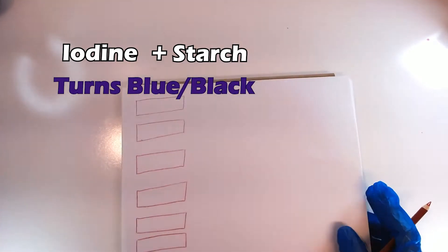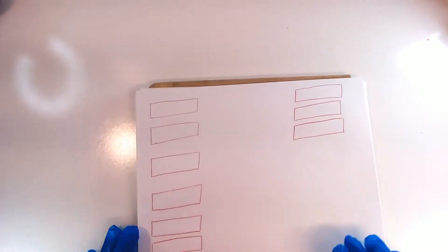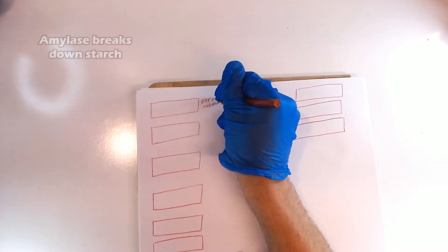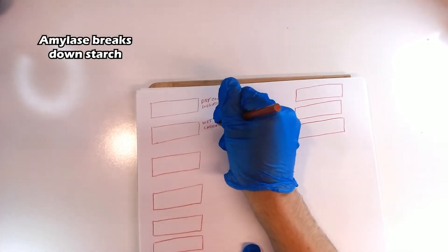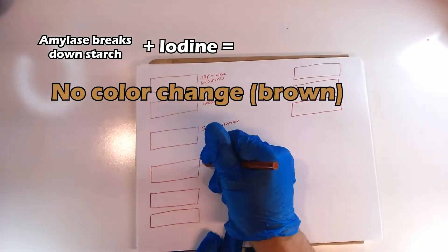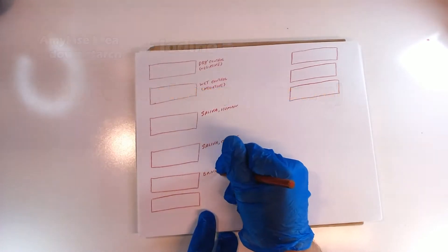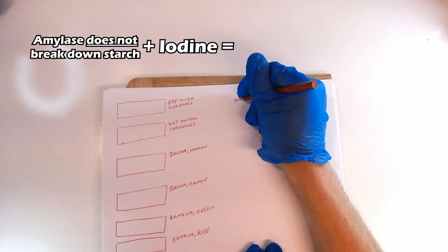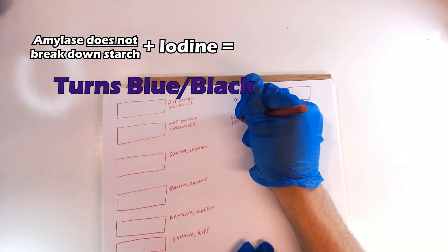Here's going to be our simplified experiment. We are going to apply residues from various substances — food, saliva, that kind of thing — to the paper. If the substance is amylase positive, if it contains amylase, when we apply iodine to it afterward it will remain brown. Iodine is naturally brown. If the substance that we apply to the paper is amylase negative, doesn't contain amylase, the iodine that we wipe on it afterward is going to turn black as it ordinarily would when we just apply it to starch.